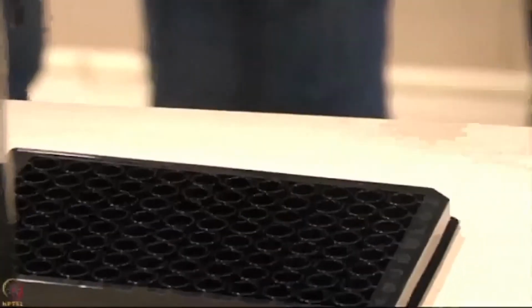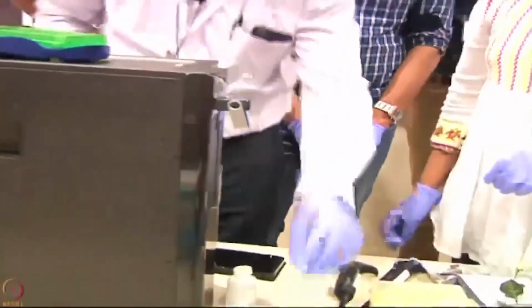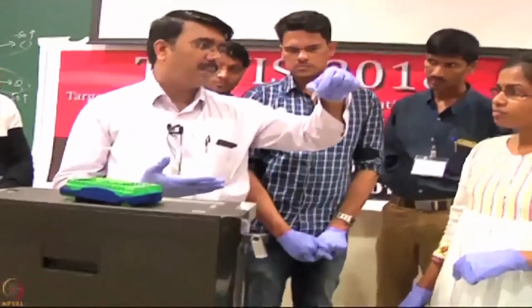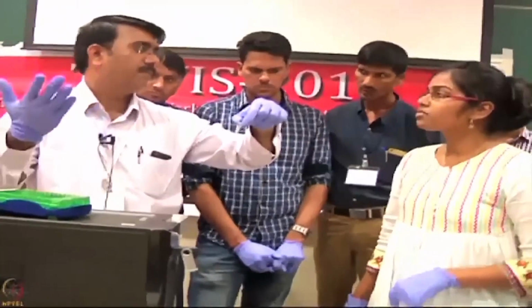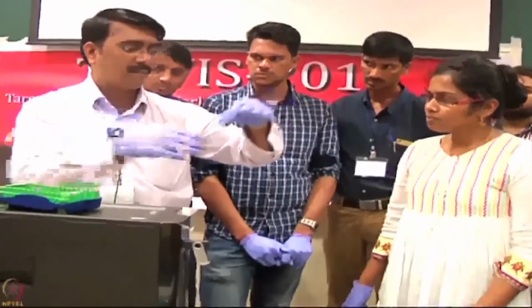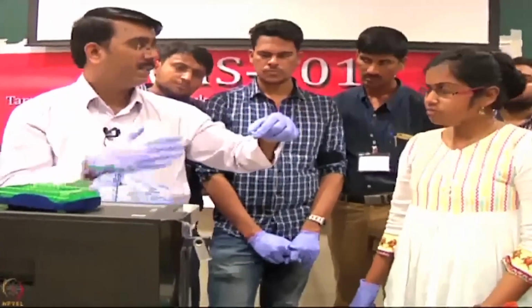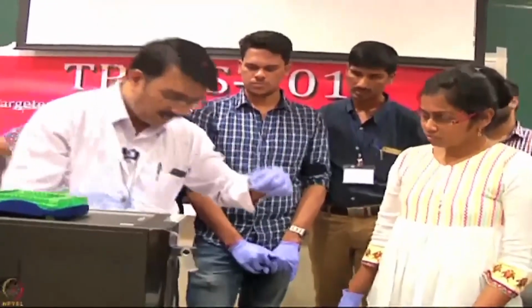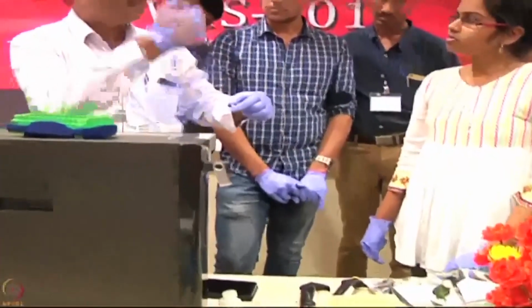Fine, done. Now we have to make the binding partner, the mouse monoclonal antibody. This is exactly 1 mg per ml, and I have 20 microliter here. Take 10 microliter or 5 microliter and transfer to the corresponding 1 ml or 500 microliter. I take 5 microliter and put it into 500 microliter, which corresponds to 10 microgram, the starting concentration. Transfer 300 here and put the rest as buffer, then do the serial dilution.